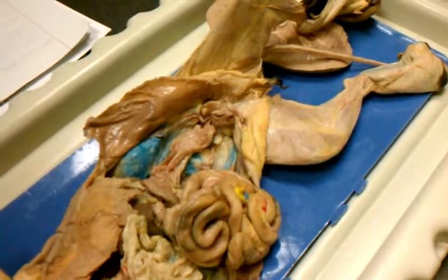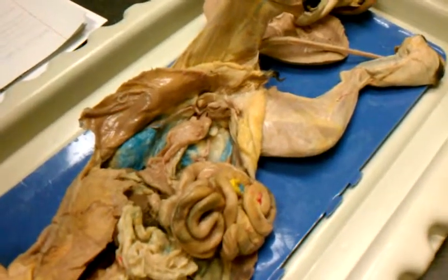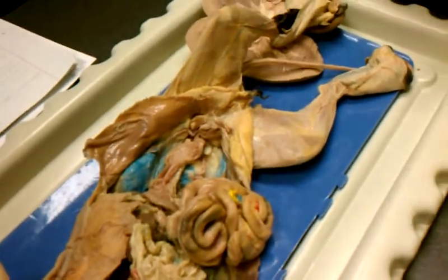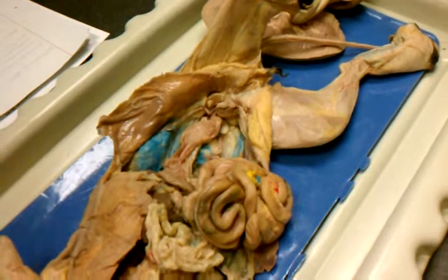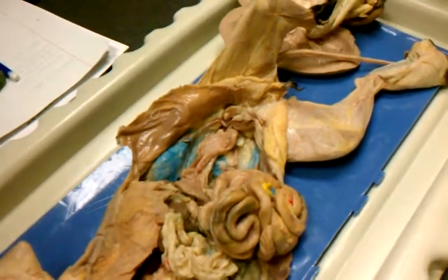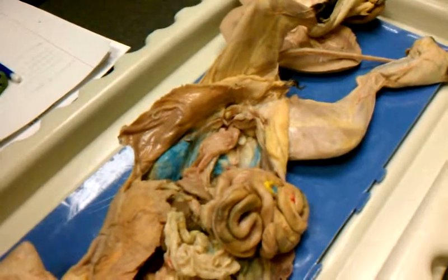Does that make sense? No fallopian? Yeah, not really fallopian tubes on cats. So do the 2 things connect as one when she's pregnant? Like the 2 ends of the Y? No. So there's multiple cats in each section? Mm-hmm. That's so cute. Wow.